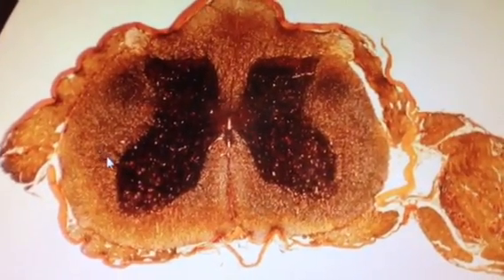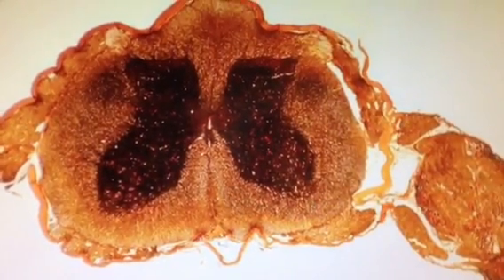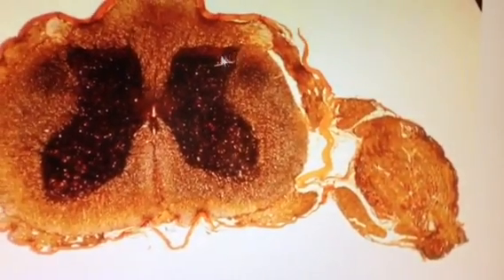This is a cross-section of the spinal cord, including the dorsal root ganglia right here. This structure carries afferent or sensory neuron unipolar cell bodies that are headed into the dorsal horn of the gray matter.